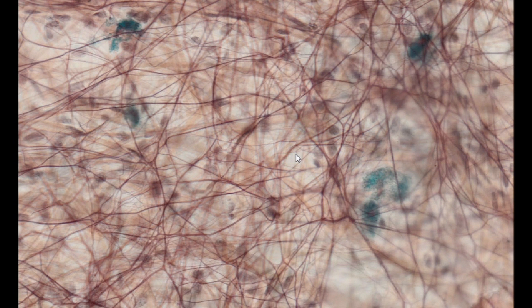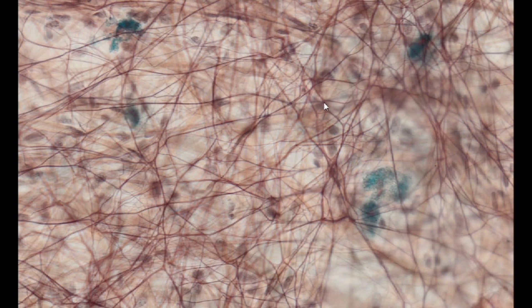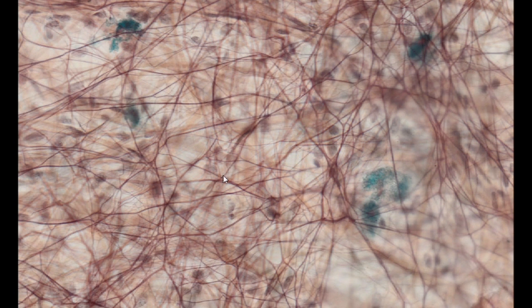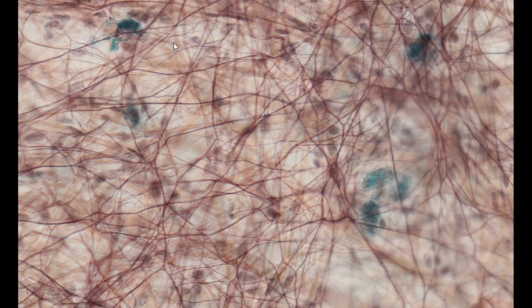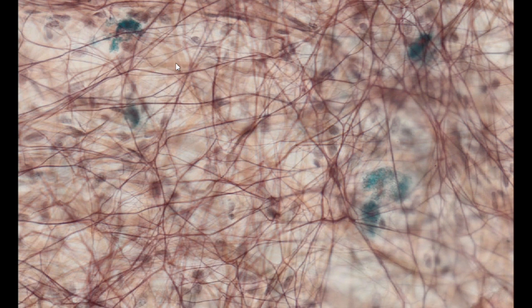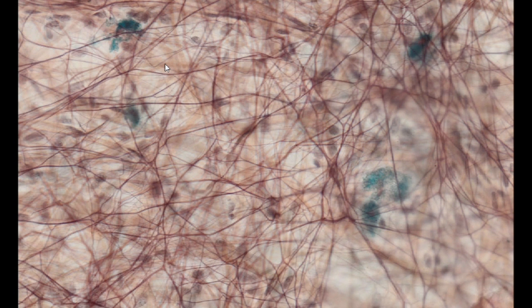In orcine staining, brown coloured elastic fibres forming a network are visible. Non-specifically stained, thick intersecting yet unbranched bundles of collagen fibres run in their vicinity. The presented staining method does not allow to demonstrate the above-mentioned third type of fibres, i.e. reticular fibres.